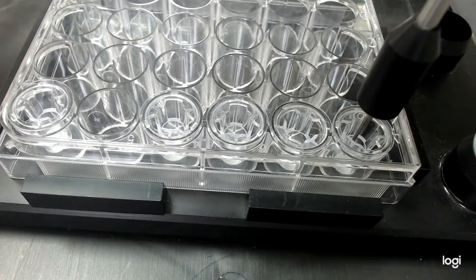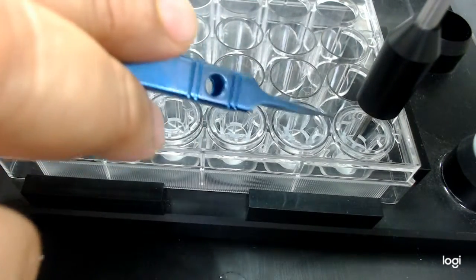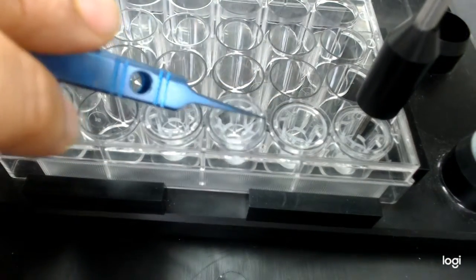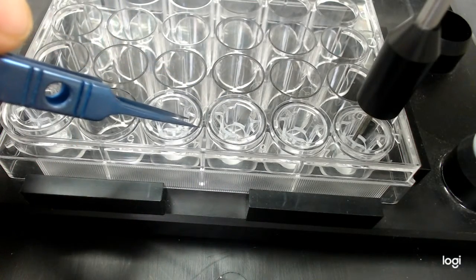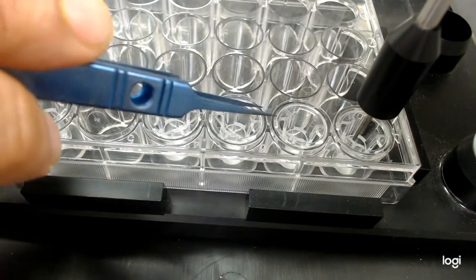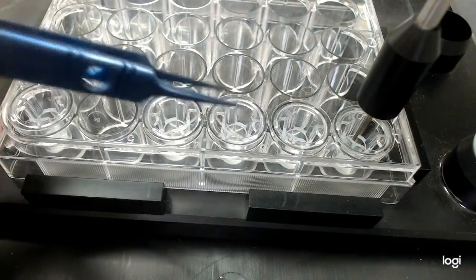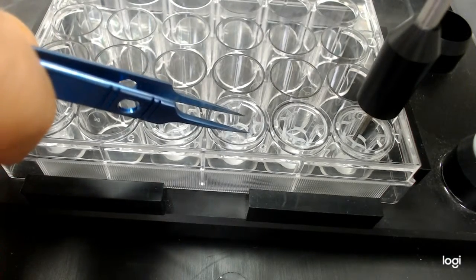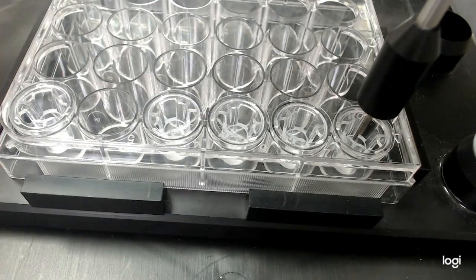What I'm trying to say is, if it comes in this spot, it will come to the same spot in this well as well. So the user has to make sure that the same spot is available here, here, and here. I'm going to intentionally leave one of these spots wrong, and even if you make the spacing right or in the same orientation, this still could be a problem. The reason is this moves, so if it is a little forward or backward, that will create a problem as well. Okay, coming back to running the software.